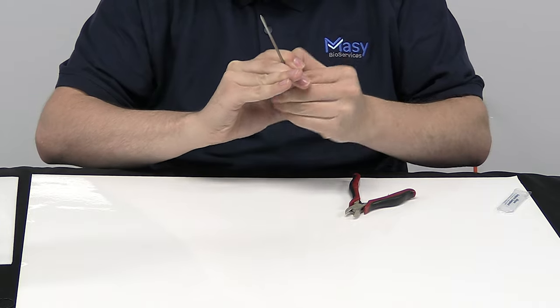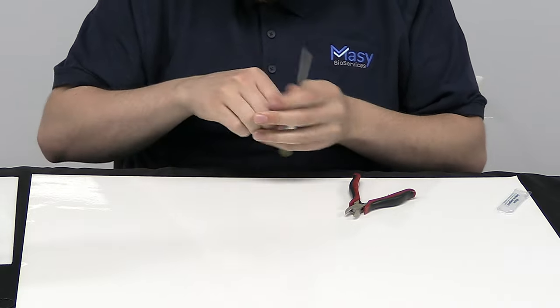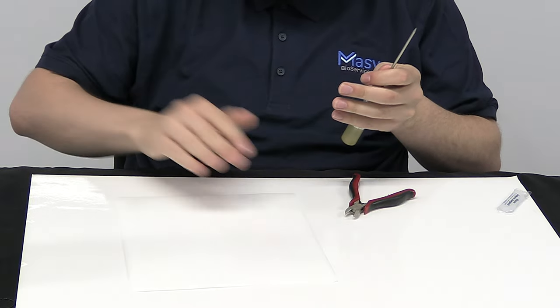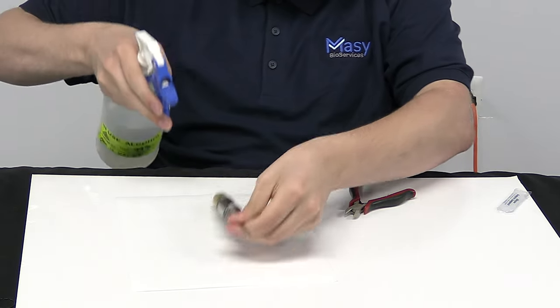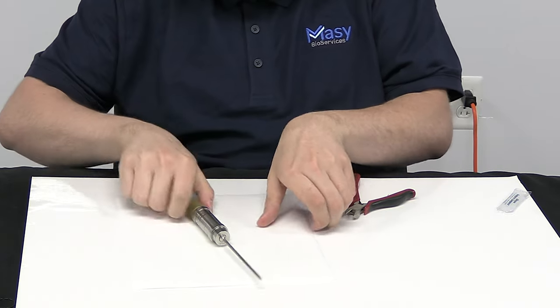And as a final step for any excess silicone grease, we take a rag and some isopropyl alcohol, and we spray the unit down, and just wipe it dry.